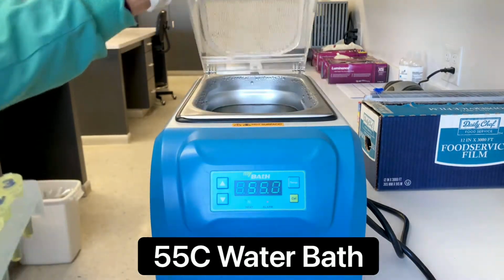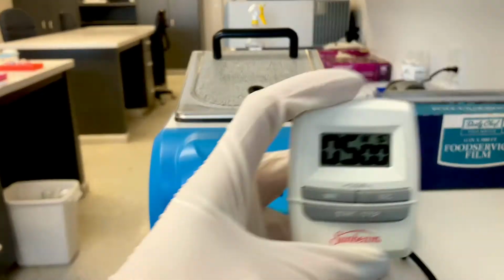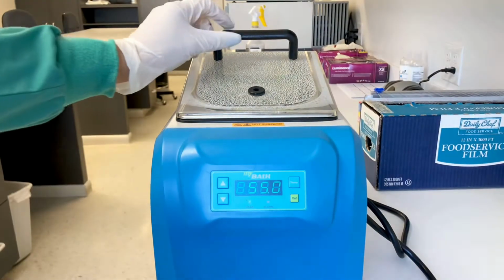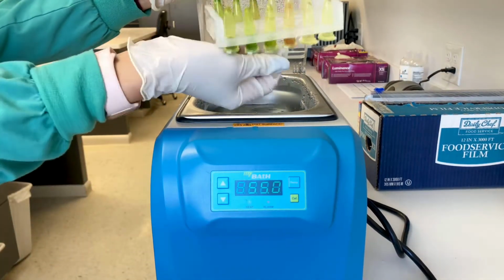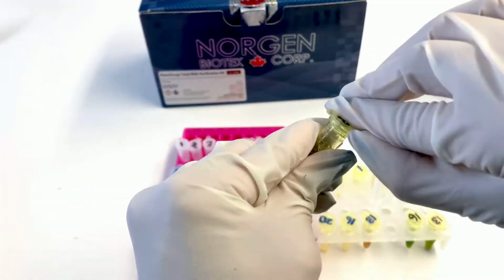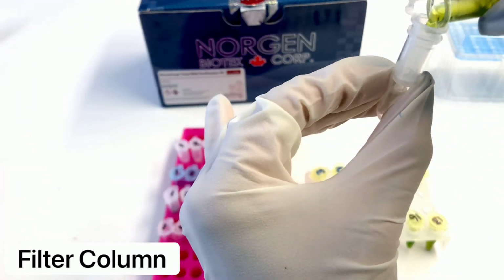Now we will place the tubes in a 55°C water bath and incubate for 5 minutes. At the half mark point of the incubation, you just want to invert the tubes to gently mix. Now we are going to take our lysate solution and put it in a filter column.